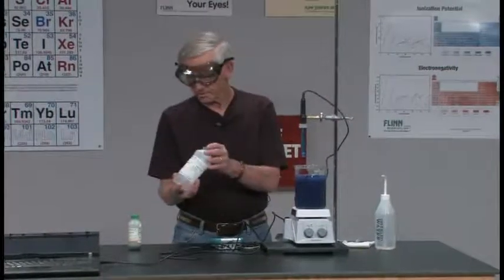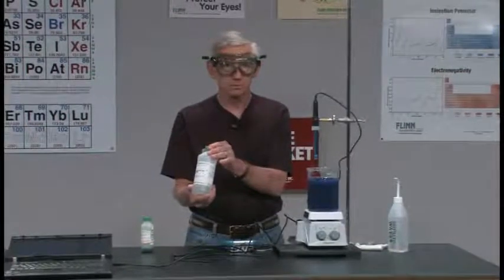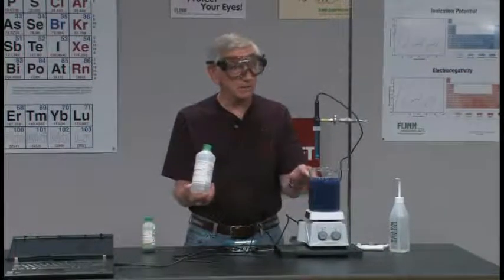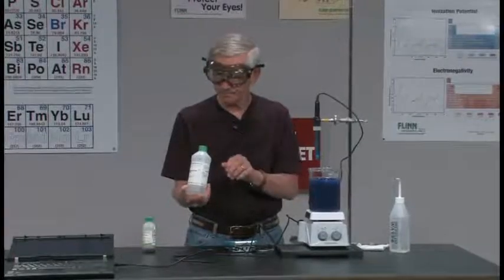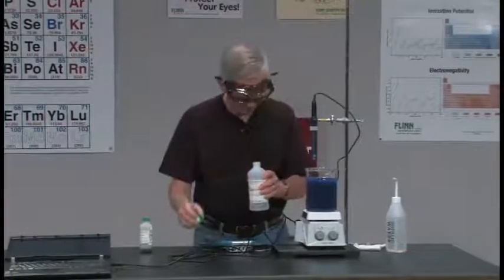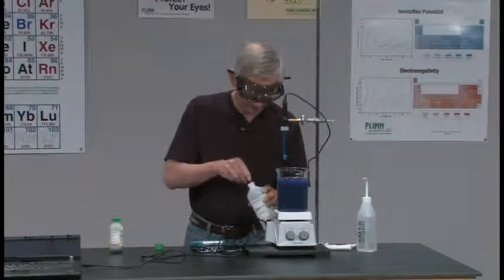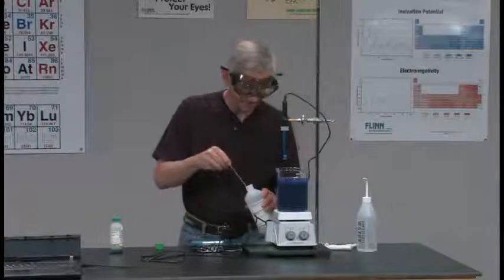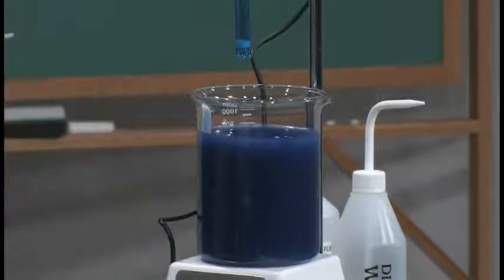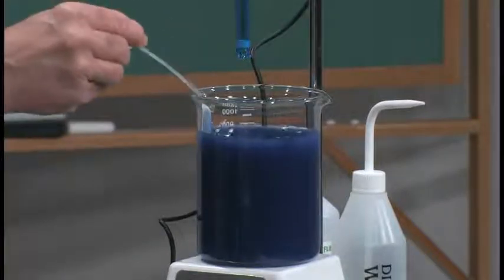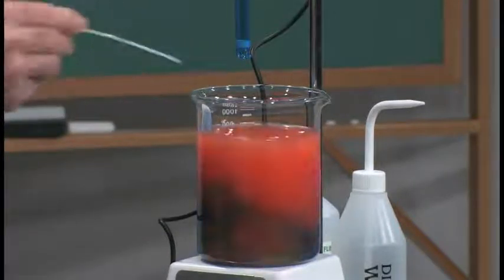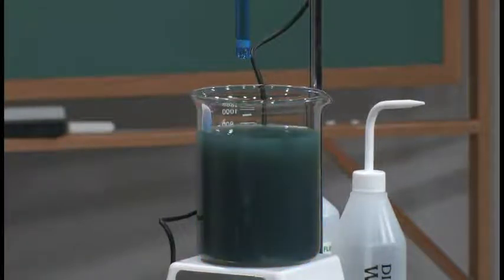This is hydrochloric acid. This happens to be 3 molar. What I'm going to do is shoot this into here a little bit at a time and let's take a look at what happens. Watch the colors on this as I shoot the hydrochloric acid in.